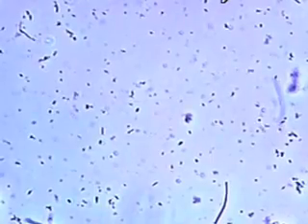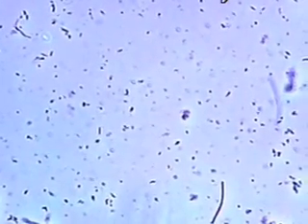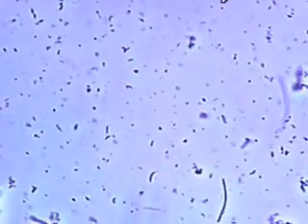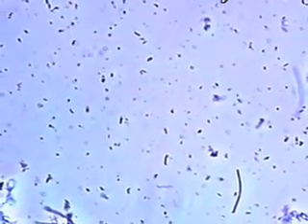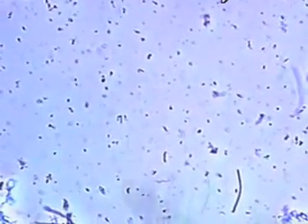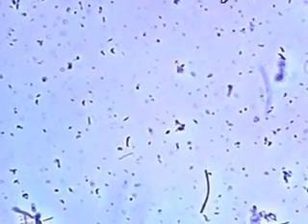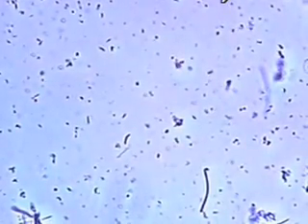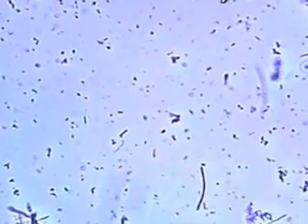In that way people can see for themselves germs. So we have long thin ones, and we point out ones that are curly or corkscrew in shape — others are quite round. You can see this corkscrew one there.